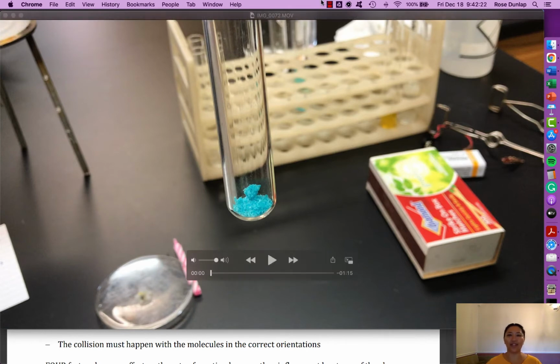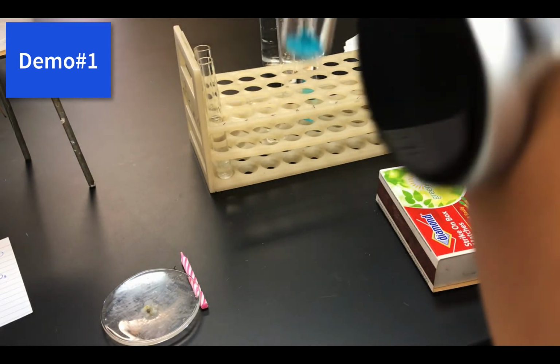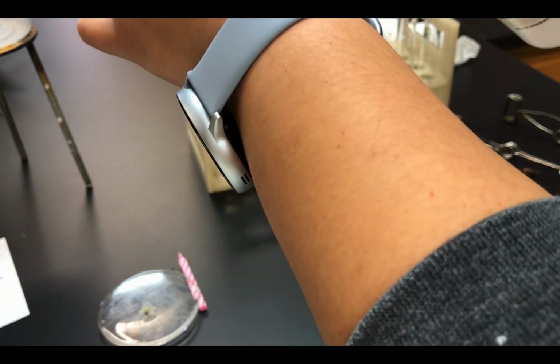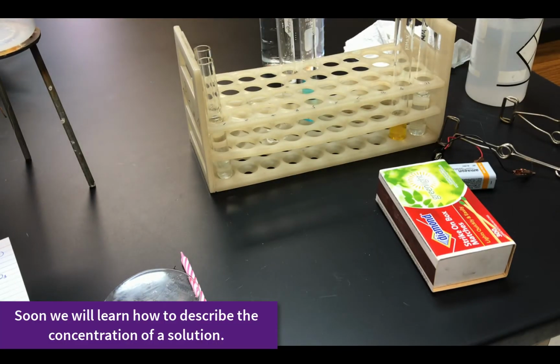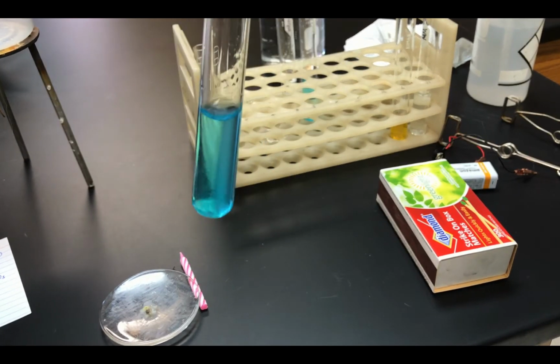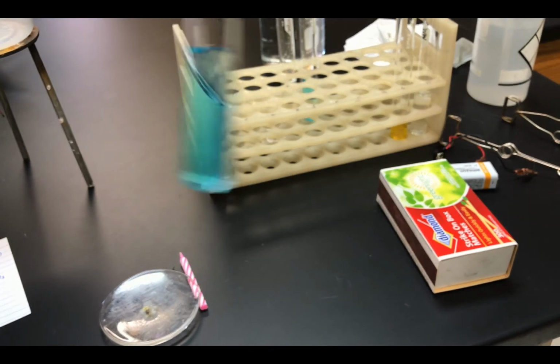All right, let's go. Demo number 1 says that we're supposed to have some aqueous copper chloride, but here we have solid copper 2 chloride. How do we make it aqueous? We add water, because that's what aqueous means. Yes, we have water plus solute. That solute dissolves. The resulting solution is our aqueous copper 2 chloride, right? So once we dissolve it, it is that characteristic bluish color we talked about in class. That means copper 2 ions are present.